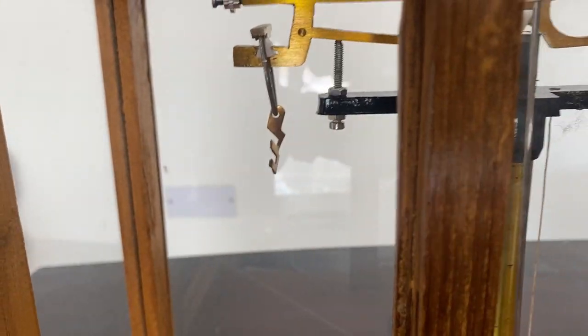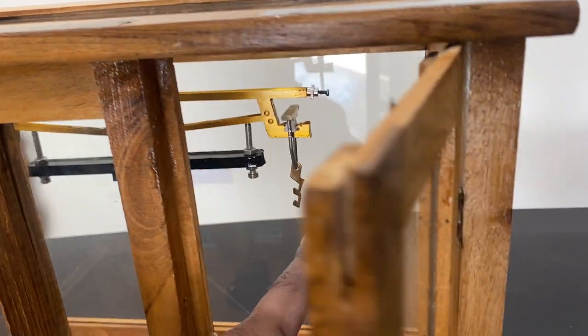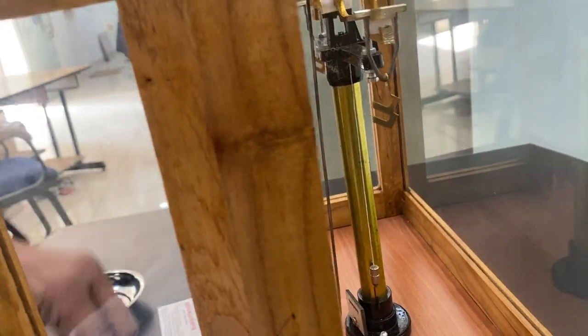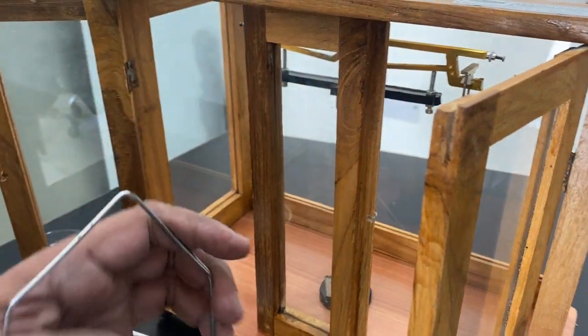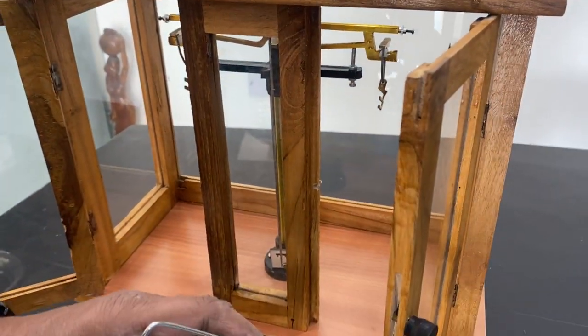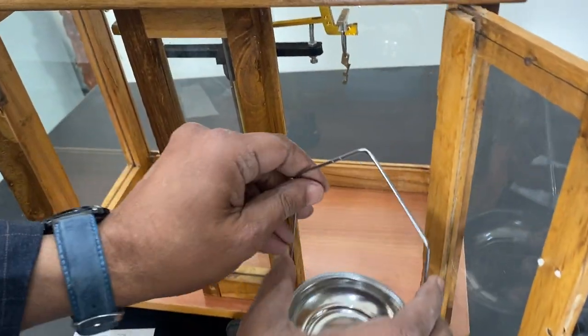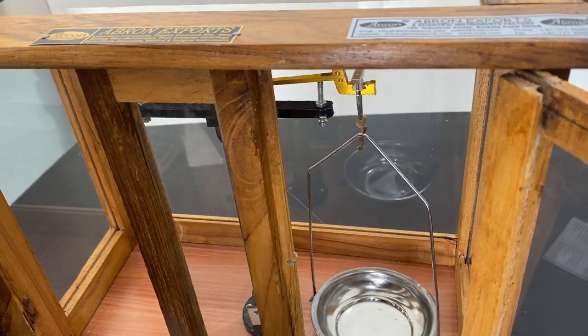This should be on the front side. You can see from the right side that this is on the front side opening. Now I open this strip, hang it here matching the two lines, and put the balance on top.